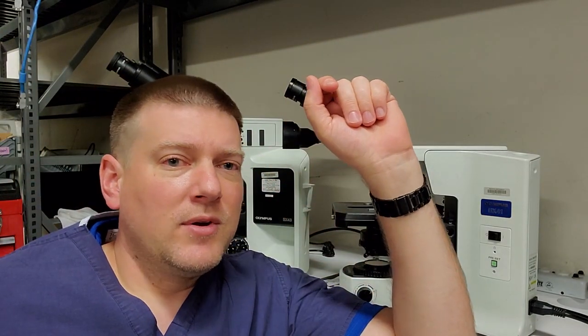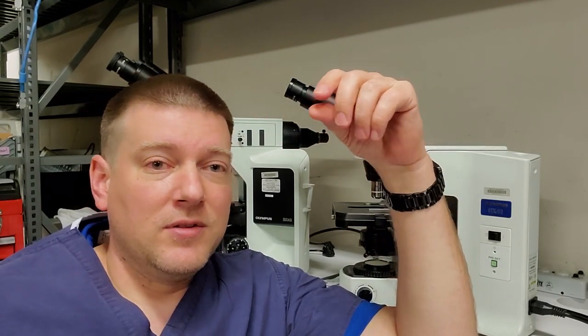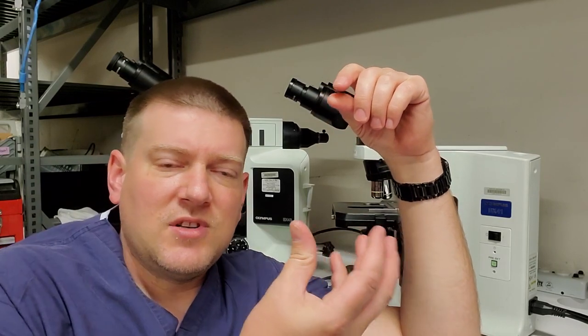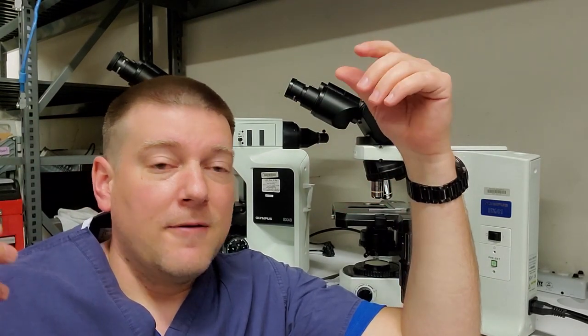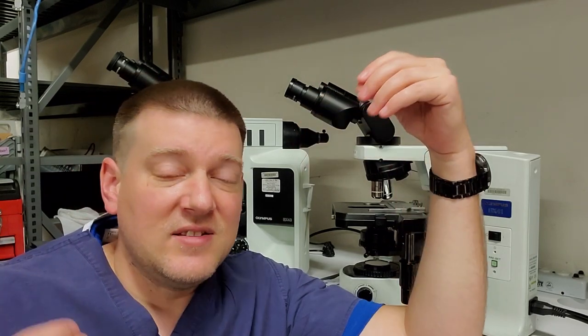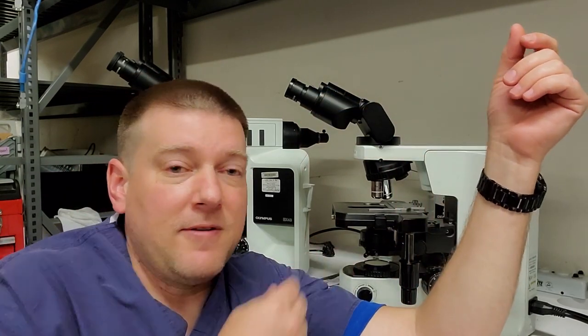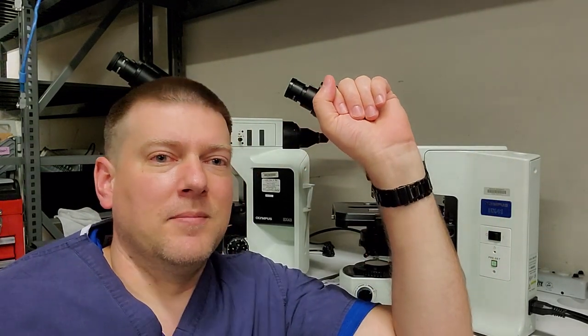There's also one called a dark field. Now, the dark field is the exact opposite of a bright field. The bright field, the light shines through your sample, and from there, the contrast of the sample is how you're able to view the sample. If there's not very much contrast, like a clear sample or a waterborne, some bacteria, some tissue samples, you have to stain the sample in order to be able to see it on a bright field. And because of this, they have something called a dark field microscope.